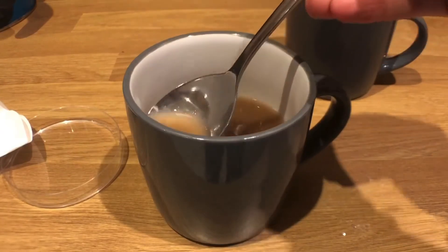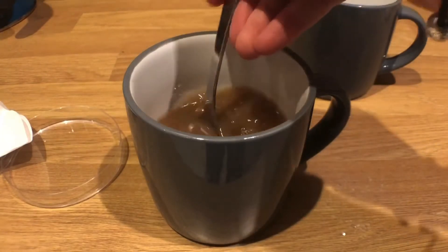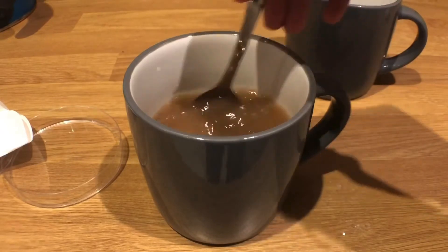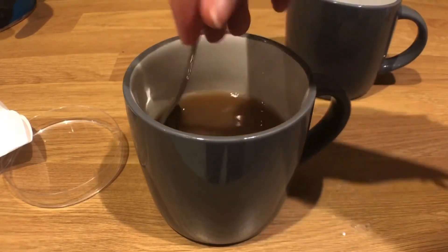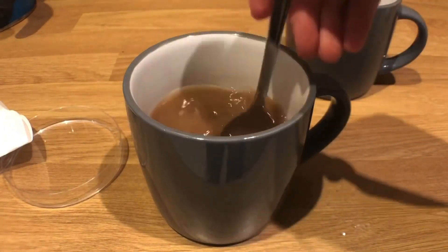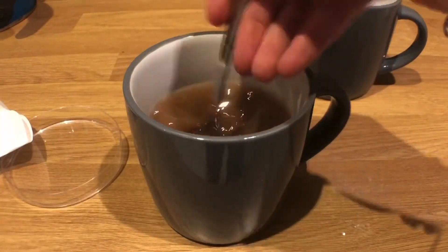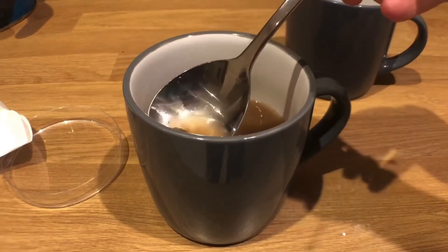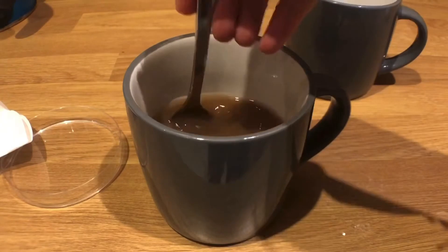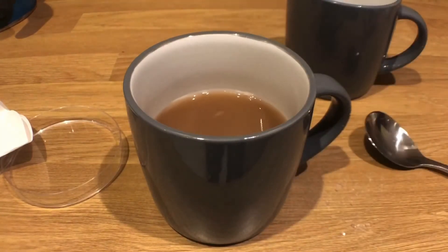I'm going to give this time and keep stirring it. We want all of the salt to dissolve. We've got grit and other insoluble substances that are not going to dissolve — we need to get rid of those in the next stage, which is filtration. It's quite warm. You can leave this longer; I'm kind of doing the fast version. You can definitely take longer on each stage than I am to get this done properly.